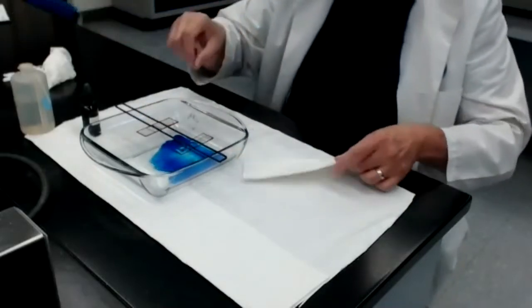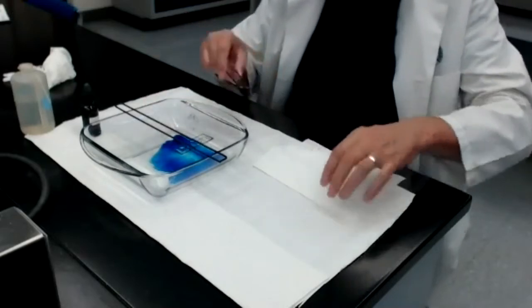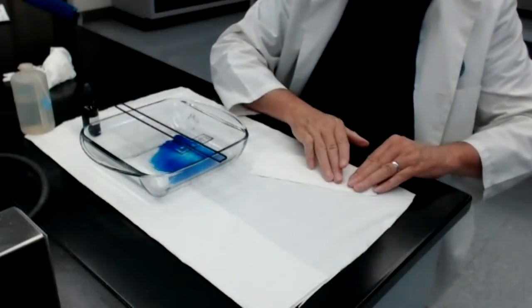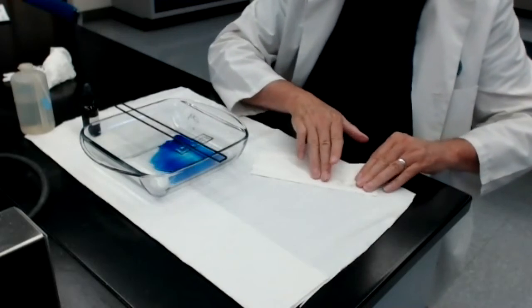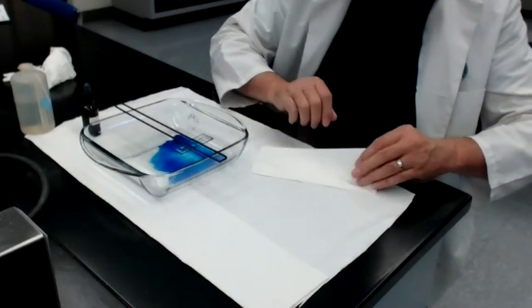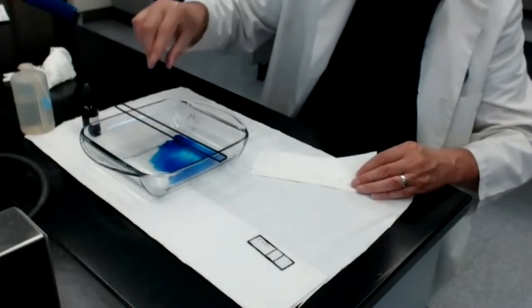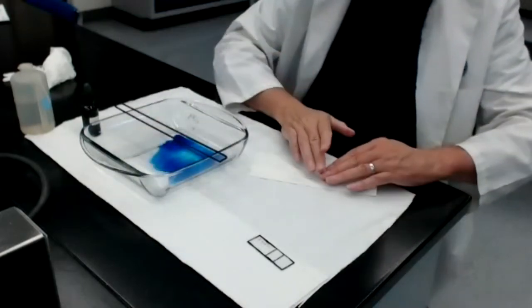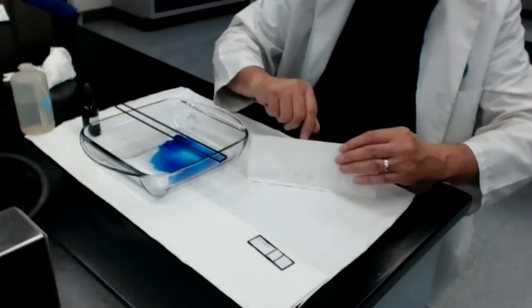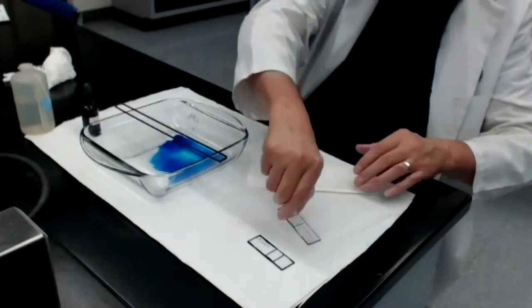And so I take a piece of folded paper towel and I'll take each slide, one last shake to get rid of the excess water, and then I will fold the towel over the slide and blot it dry. Do not rub, just blot. Okay, that slide's done. I take this one, again shake off the excess water, use the paper towel to blot the slide dry. I usually do 2 different locations in the paper towel to make sure that I get all the water off. And that slide is done.